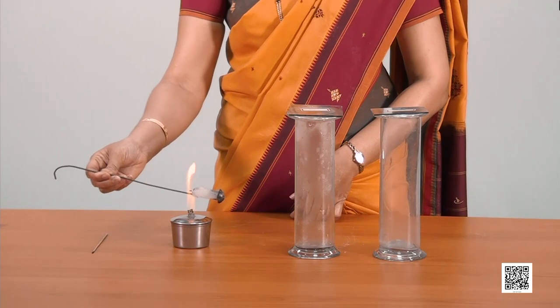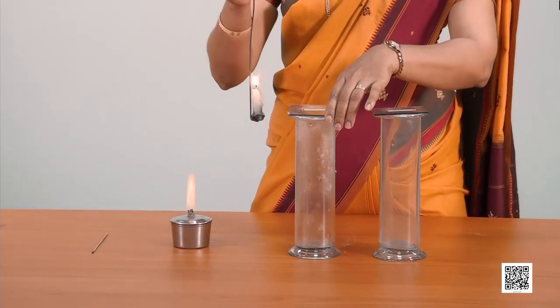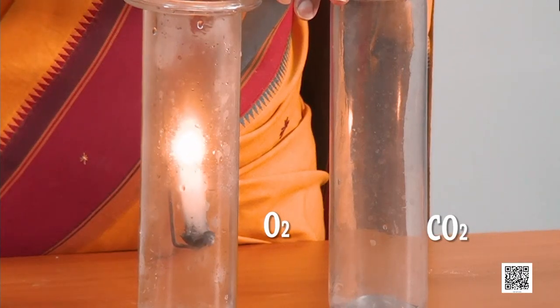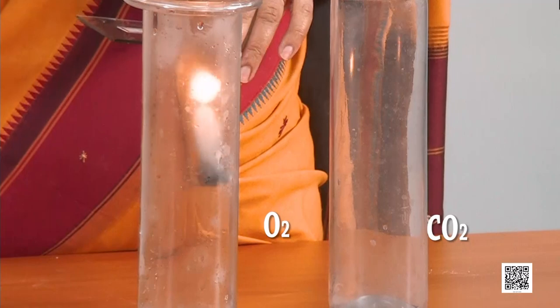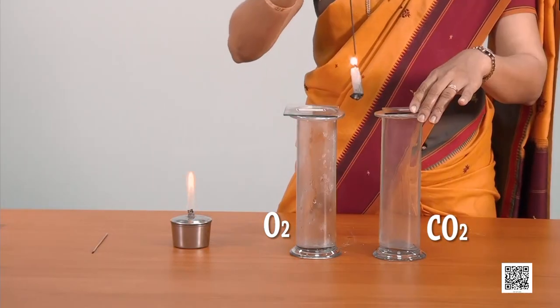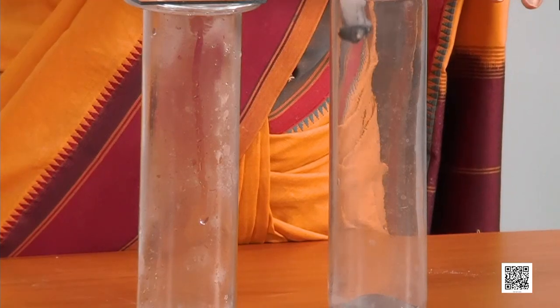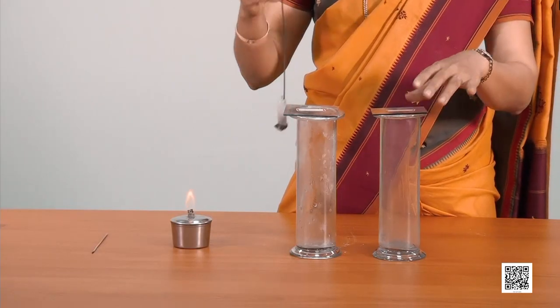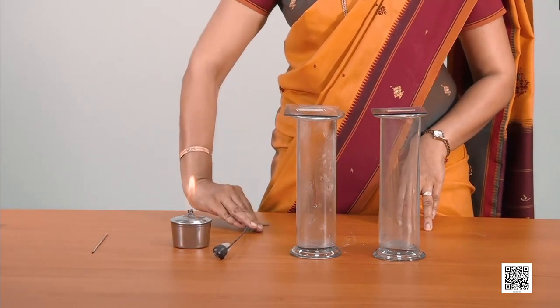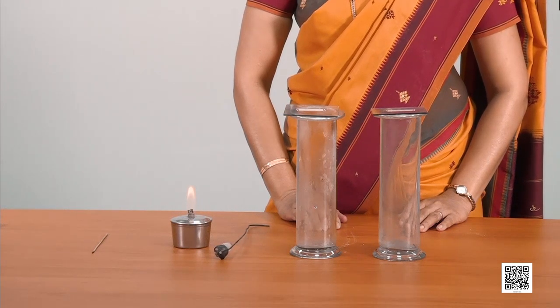I will now repeat this experiment by introducing a burning candle in both the jars. Again, you can see that the candle burns brightly in the jar containing oxygen and is put out in the jar containing carbon dioxide. From this activity, we can conclude that oxygen is a supporter of combustion and carbon dioxide is not a supporter of combustion.